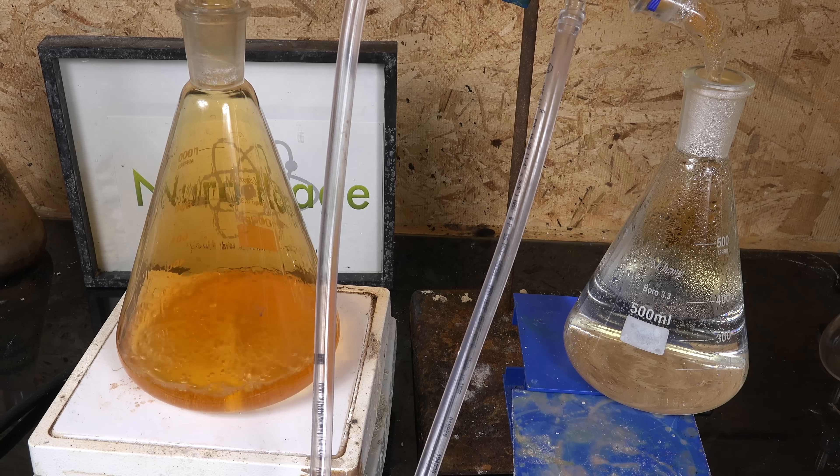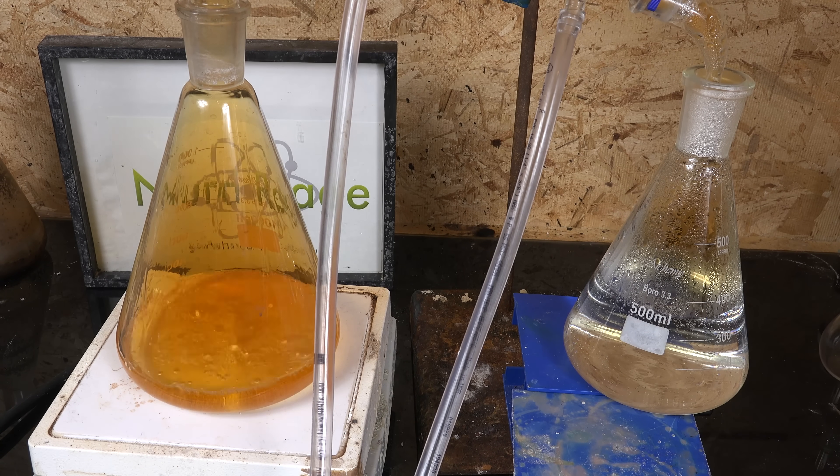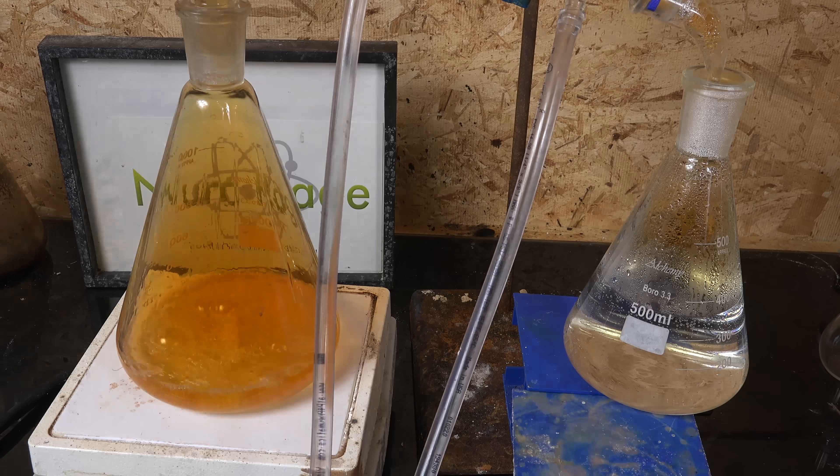Greetings fellow nerds. In this video we're going to make nitric acid by oxalate precipitation.